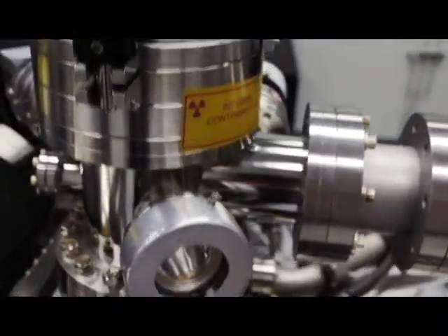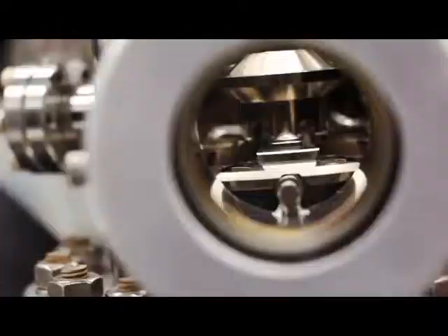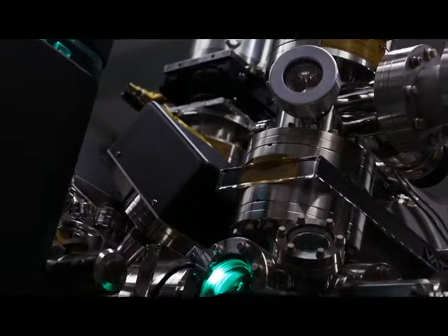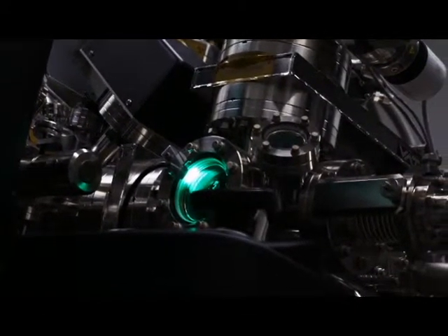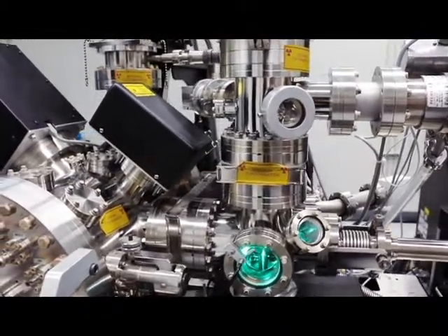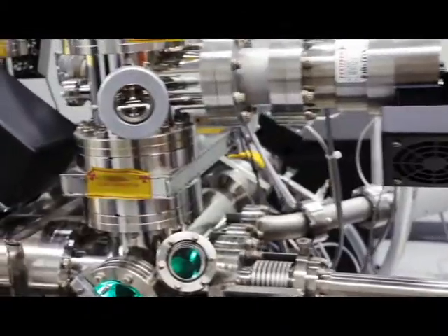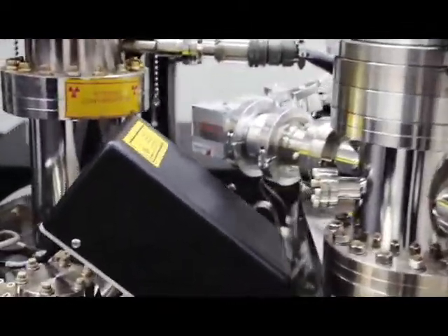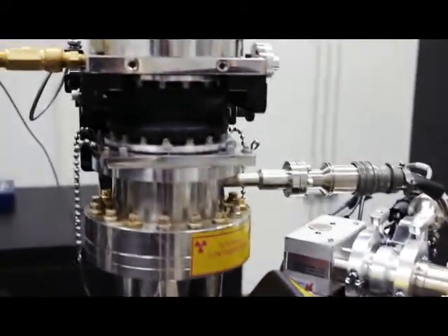We also do a lot of work in the fusion materials work, so we look at a lot of tungsten materials, looking at how radiation affects tungsten, in particular how transmutation products form clusters, which turn the tungsten even more brittle than it is in standard conditions.